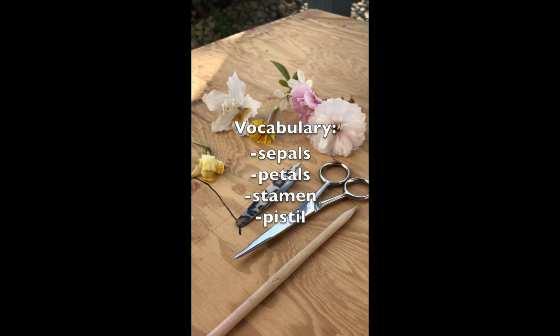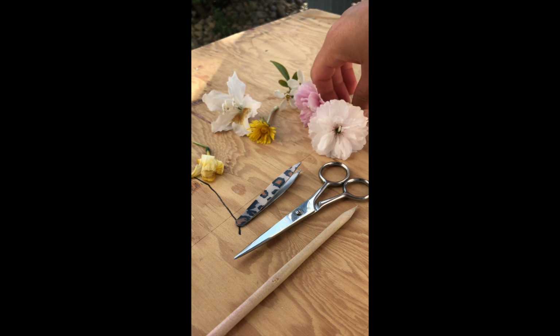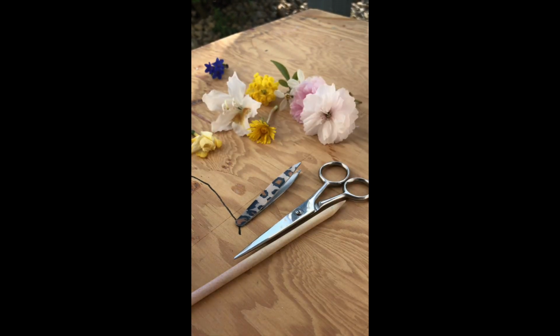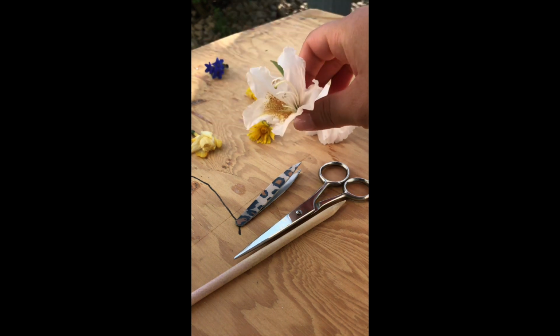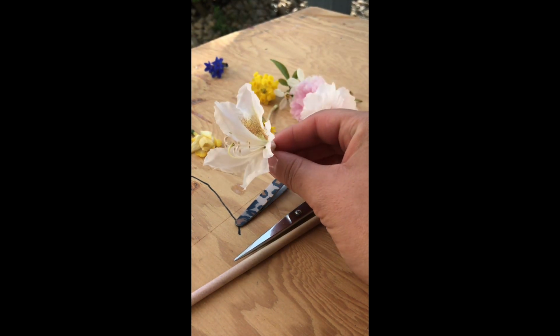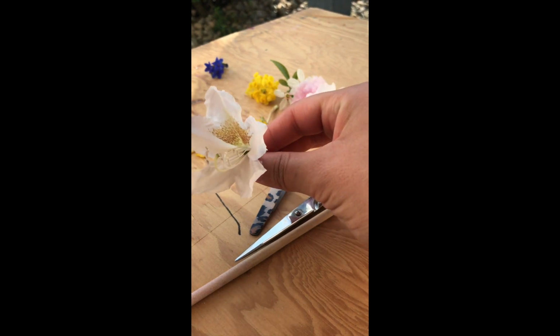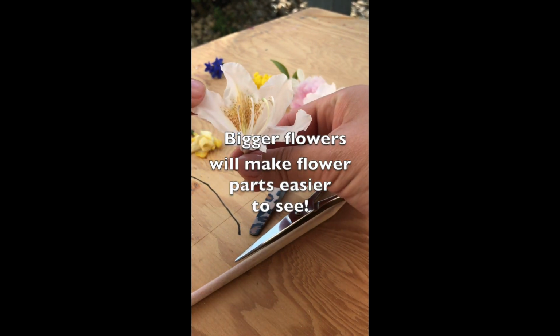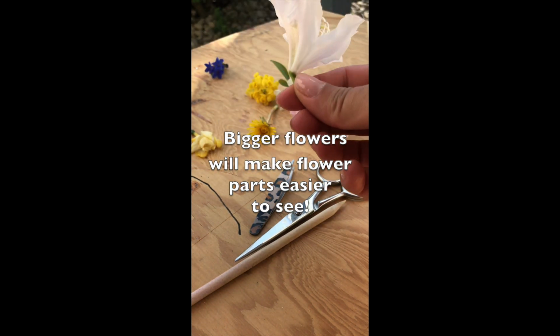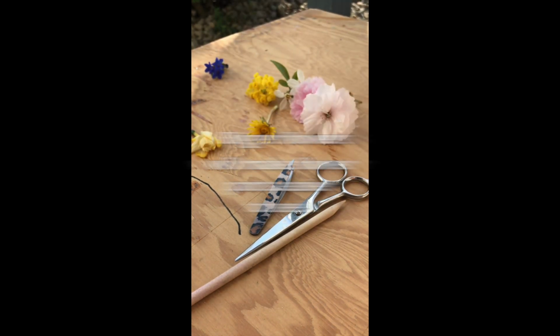So I just have here a whole collection of flowers that I went and gathered about 20 minutes ago. Flowers like this one right here, which is one of the ones that I'm going to dissect for you. A flower like this, you can see all the flower parts. They're really big. You don't really need a microscope or a magnifying glass to see really clearly. And just because it's bigger, it's a little bit easier to work with.